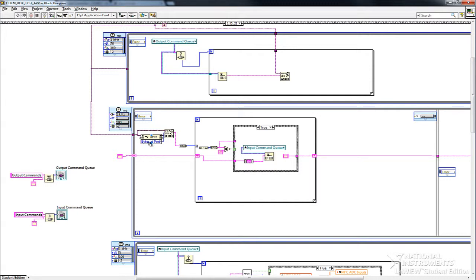Now on the other side, I have a loop that always looks at how many bytes are at the serial port coming in, and this is for the data coming back, the data that the control box would send back to me. Because everything in this USB interface works with carriage return terminated strings, that's what I'm looking for. This is a loop that builds up: it reads things from the serial port and continually looks for a carriage return. When it finds a carriage return, it takes the string it built up in a shift register and puts it in the input command queue.